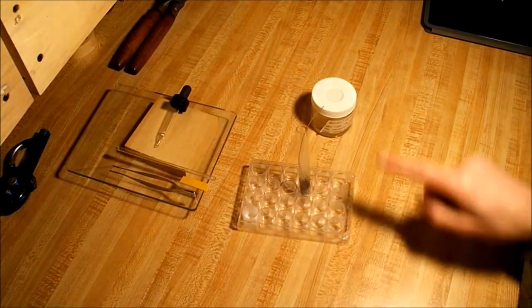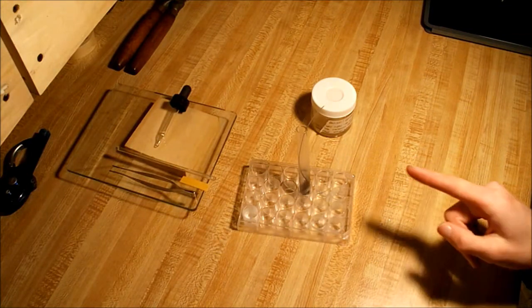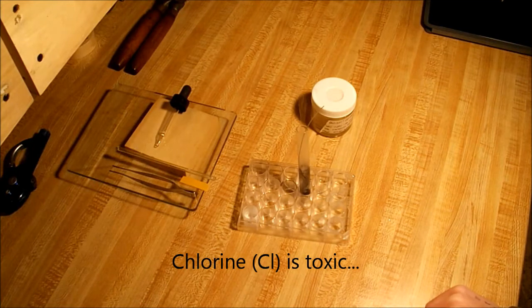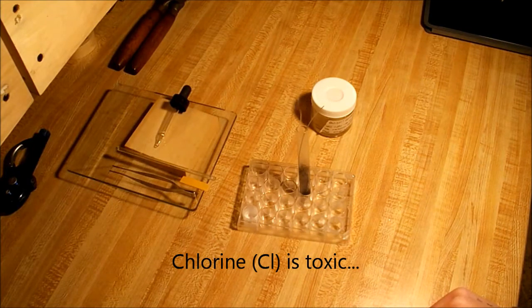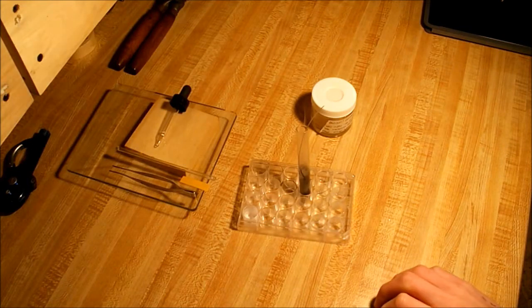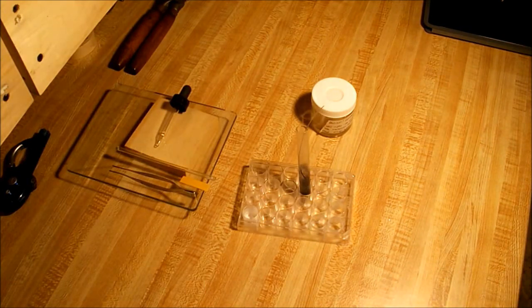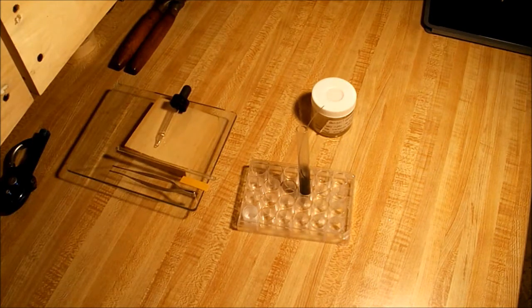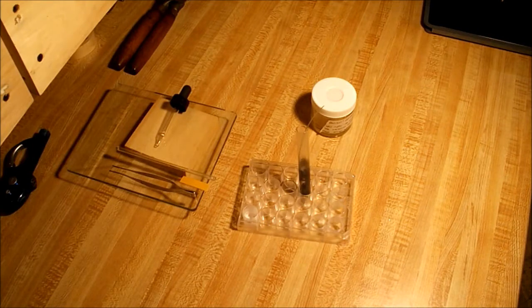As you can see the smoke rising, that is chlorine gas. You want to be very careful not to inhale that. As chlorine is very toxic to pretty much everything. As you can see there's quite a substantial amount coming out of my test tube there.